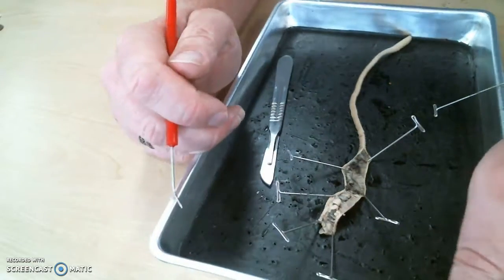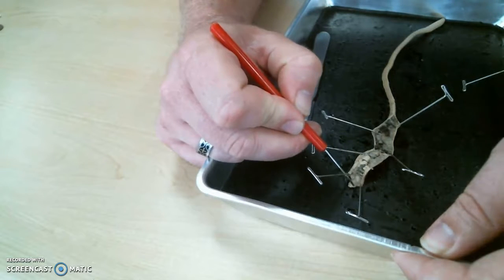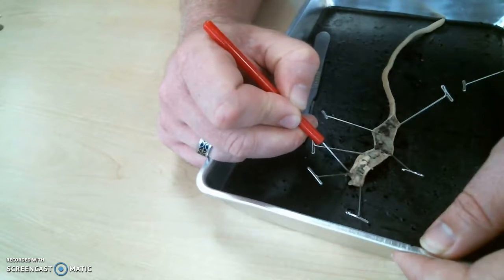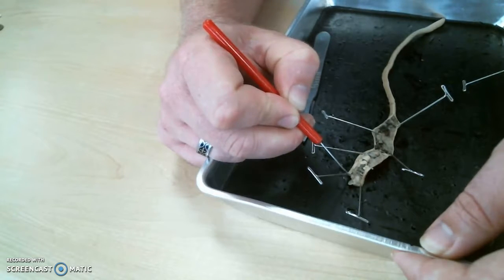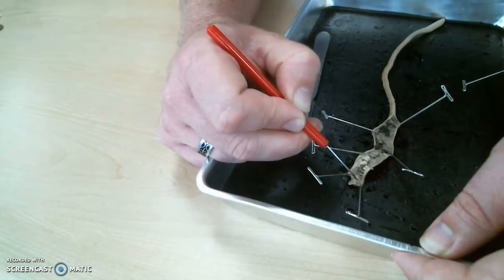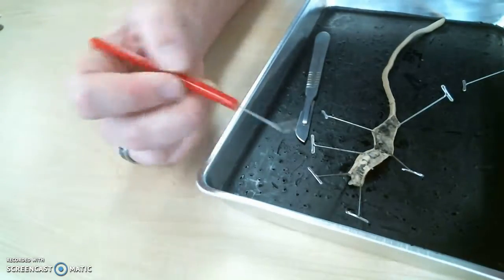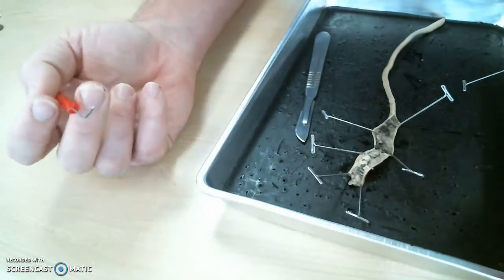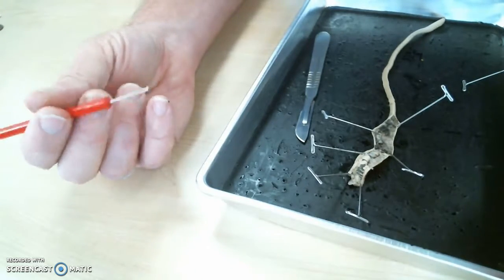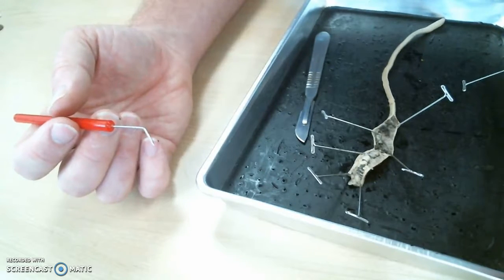Okay. The only other structure in the worm that we want to take the time to try to find is right up around the mouth. There is some nervous tissue, and it's hard to see. I think I might be fiddling with it with the probe right here. It's a little loop of nervous tissue around the mouth. That might be some more of it right there. What do you call the little loop of nervous tissue around the mouth? Ganglion. And that is its very simple version of a what? Brain. This is a very, very, very simple version of his brain.